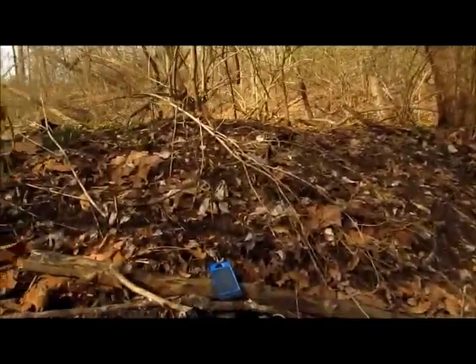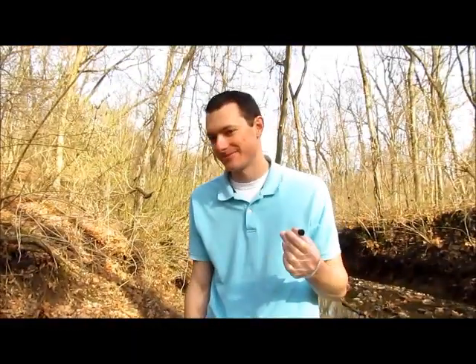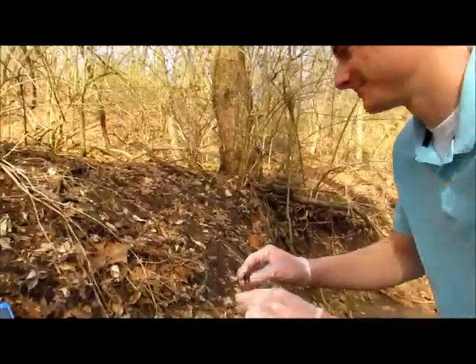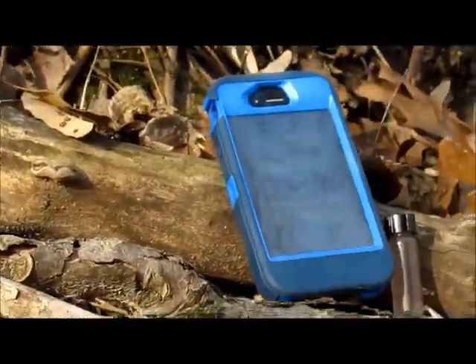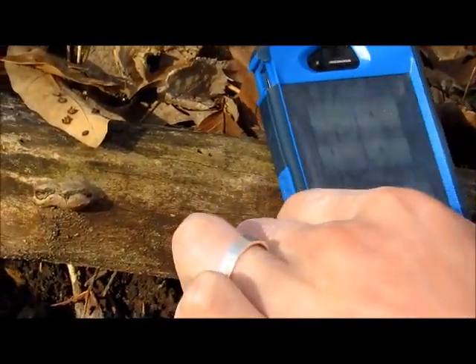When the timer is up, you're done mixing. Set your vial down, then start your timer for five minutes. This is the amount of time you'll let the vial sit and allow the color to develop.